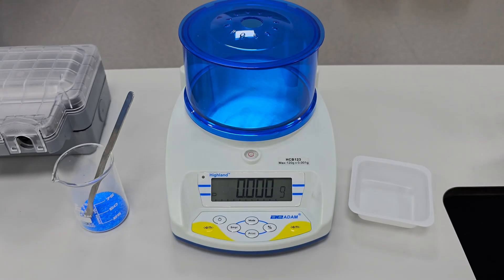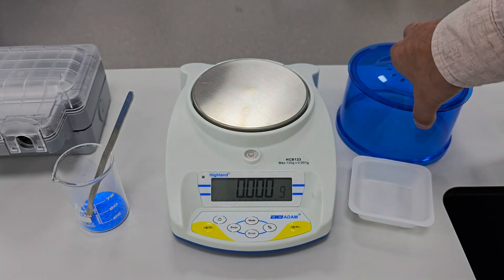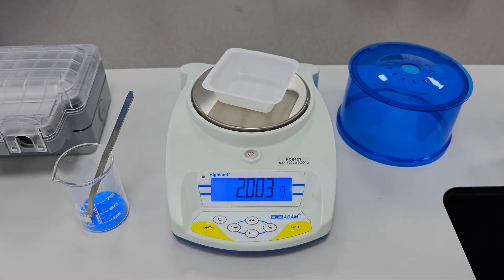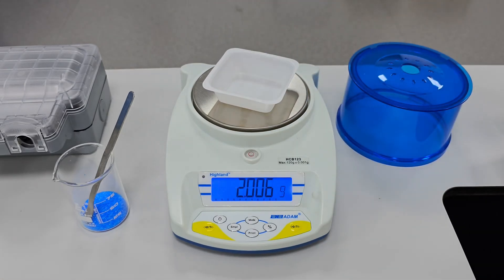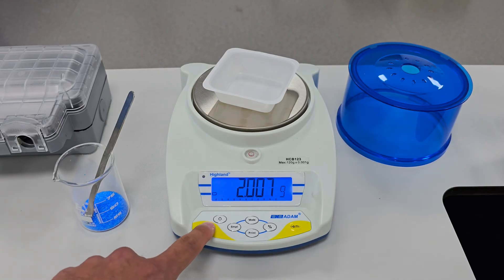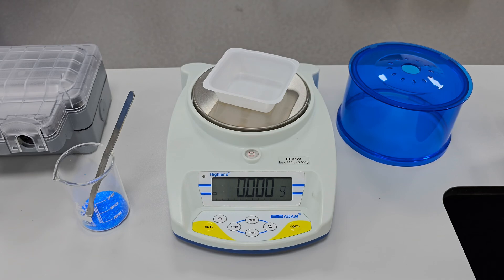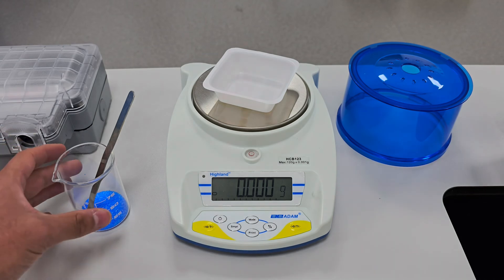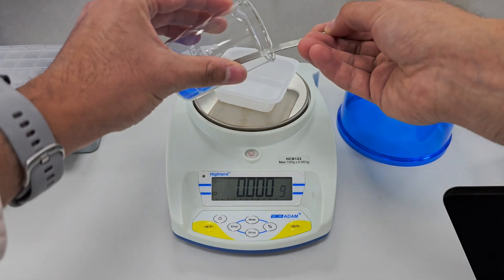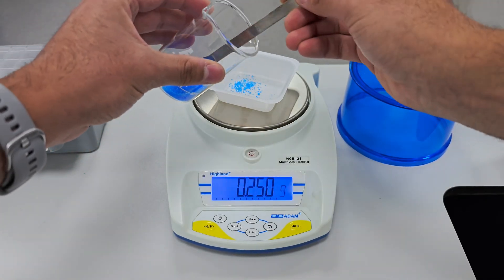Next, I weigh exactly 2.497 grams of copper sulfate pentahydrate using a precision balance. It's important to be as accurate as possible when preparing a standard solution, so take your time here. I use a spatula to gradually add the crystals until I reach the desired mass.